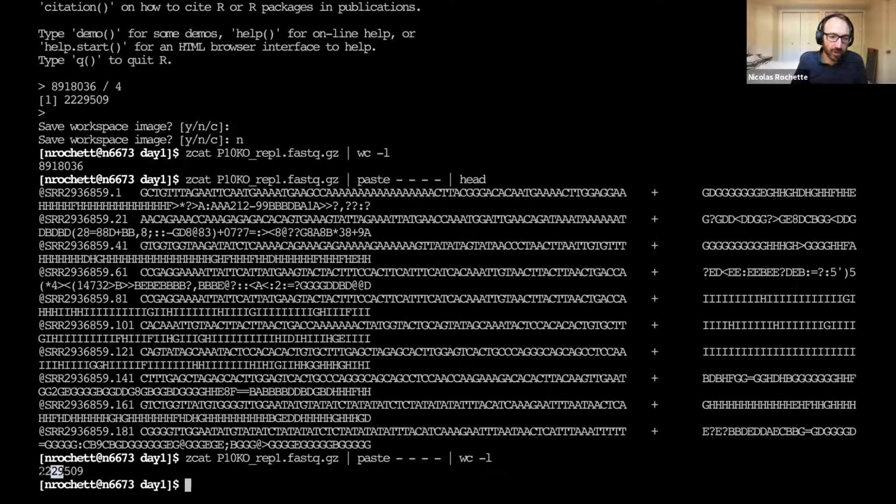Oh, and by the way, this number here, 2 million reads, is very small for a mammalian RNA-seq experiment. Normally, a mammalian RNA-seq experiment has anywhere from 10 to 40 million reads per sample. The reason we have this depressed number here is because we're just using a small subset of the dataset. Today the commands are fairly fast to run. It still takes 5 seconds here to just count the lines. If we had the full dataset, which is 20 times bigger, it would take a minute or two. So we'd just sit there and wait, and for the more computationally intensive steps we're going to do tomorrow, as you're going to see, everything takes more time, even with a small fraction of the dataset.